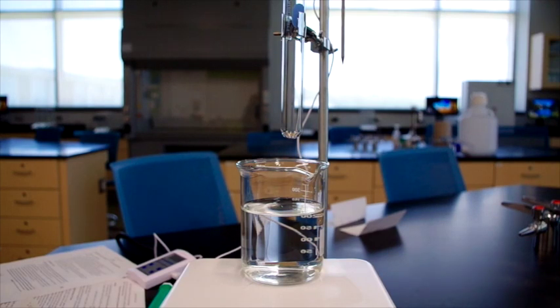Okay, so for part B, we're going to be measuring the solubility of potassium nitrate with reference to temperature increase. We're going to start by adding our 2.856 grams of potassium nitrate to our test tube. We will do the same in another trial for the other 2 masses that we measured out. However, we're only going to show the experiment once, and we're going to give you the data for the other 2.